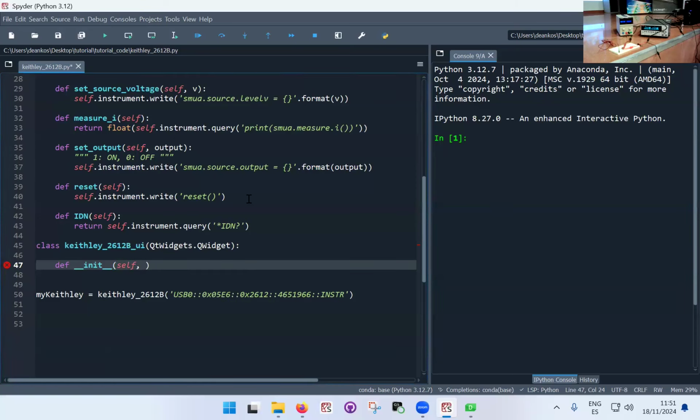And now this is a Keithley interface class, and I'm going to have to give to this Keithley interface class the instrument itself. So I'm going to put this as an argument, as a variable here in the init, the Keithley itself. So when I generate this class, I'm going to pass the Keithley object, which in my case here is my Keithley.